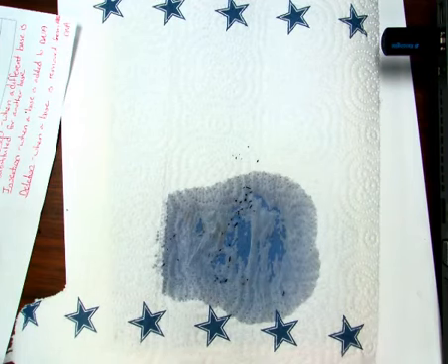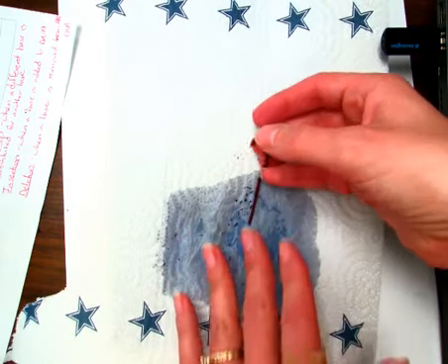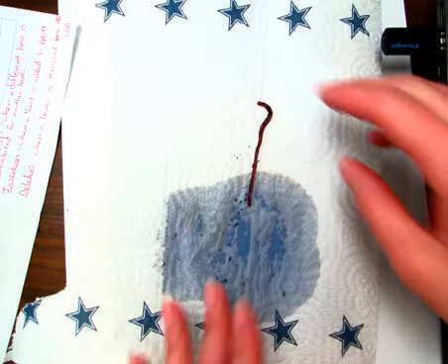We're now going to look again at his response to touch. This time around, I want to stretch him out. Head starts on the wet with his tail on the dry region.